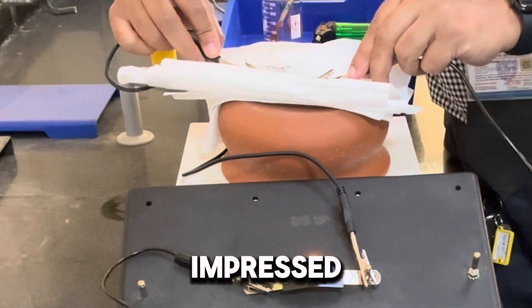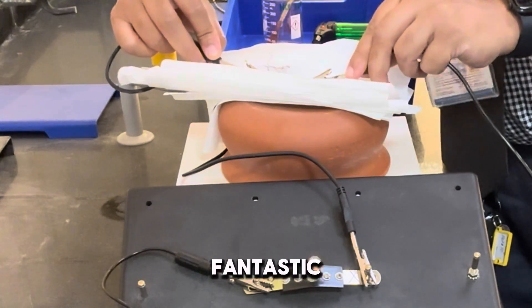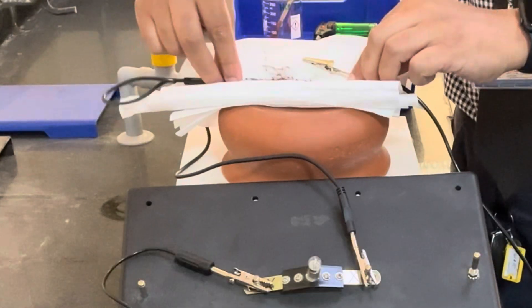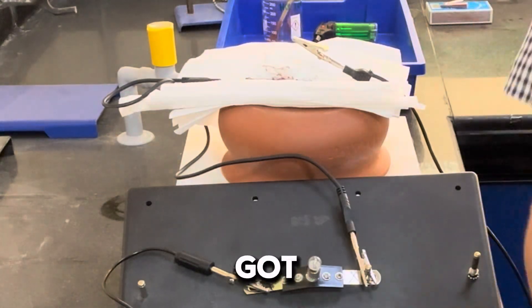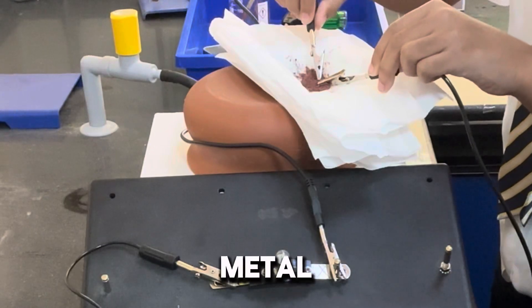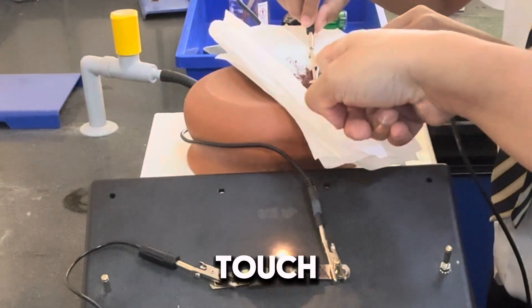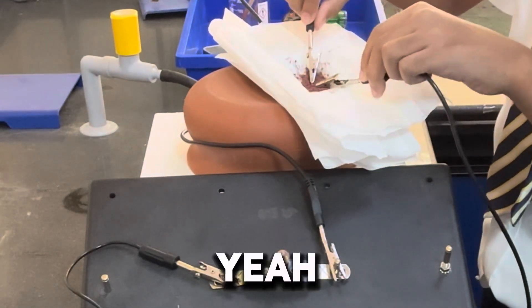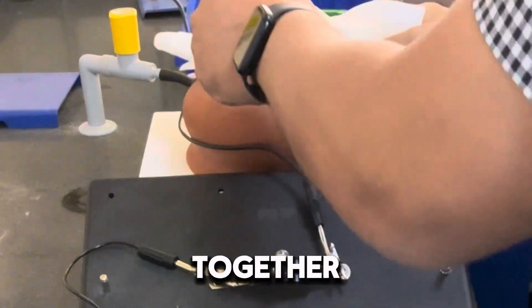Are you impressed? Yes! They're impressed. Fantastic. Brilliant. If you'd like to try this, I'll switch the video off and let you try it now — as long as you've got your goggles on. Got copper! So, just an example of a metal — how is it a metal? Is it like shiny? You don't have to touch the ends in order for that to conduct. Let me just bring it together as a column.